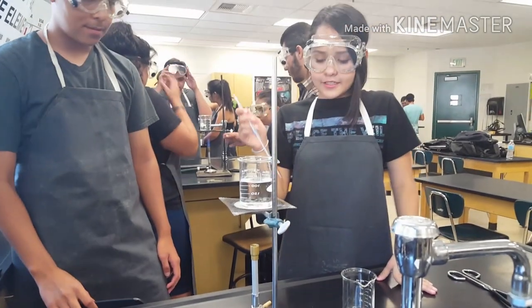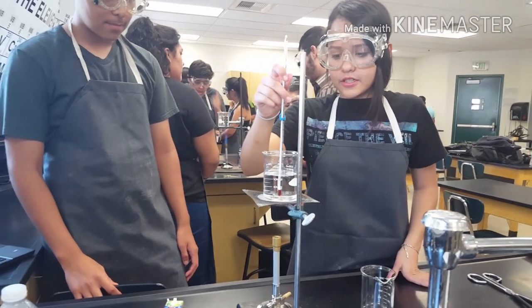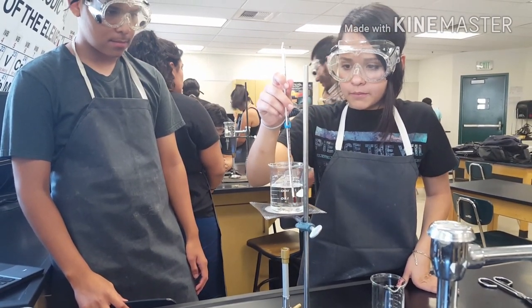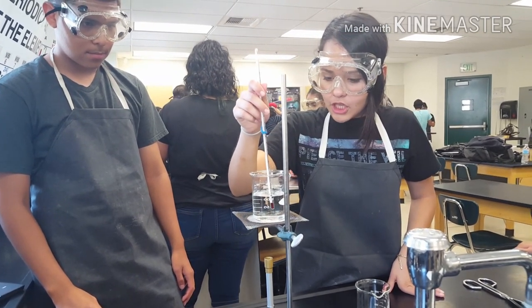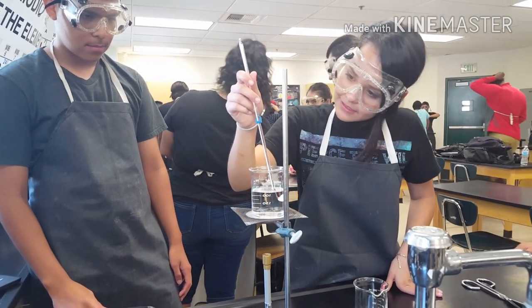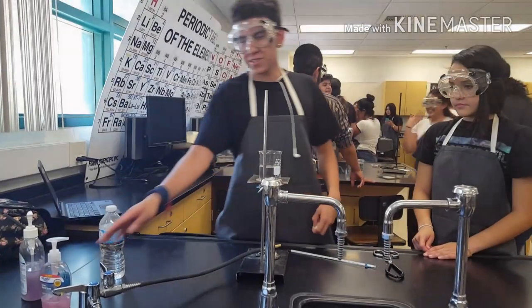Before starting it up, make sure you check the room temperature. It's going down to 23. Then you start the gas.